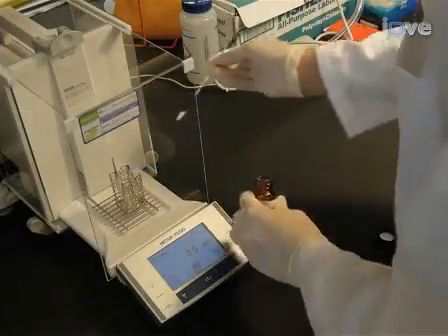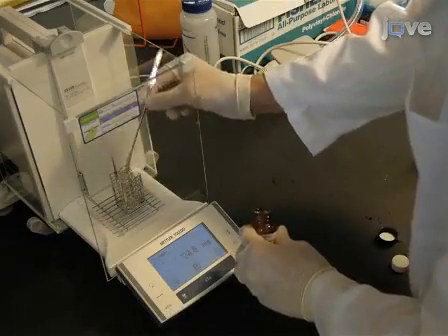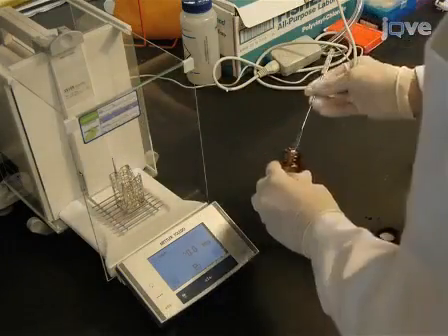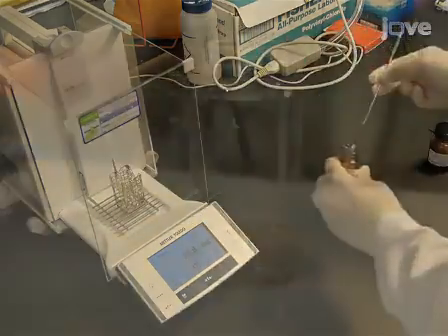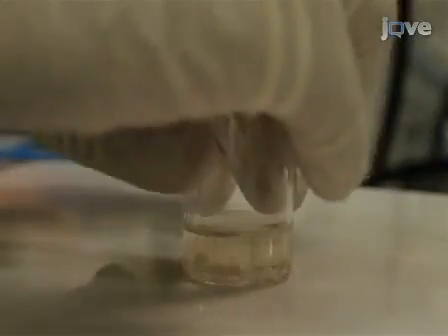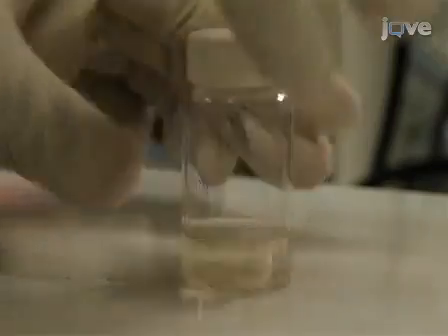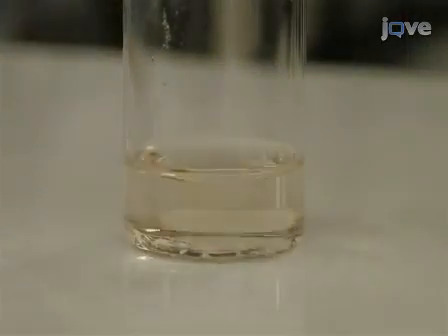Then, add enough NHS and EDC to obtain concentrations of 25 millimolar, providing a 5x stoichiometric excess as compared to PLGA. Gently stir the solution for about one hour to allow the PLGA carboxylate to be converted into PLGA NHS.